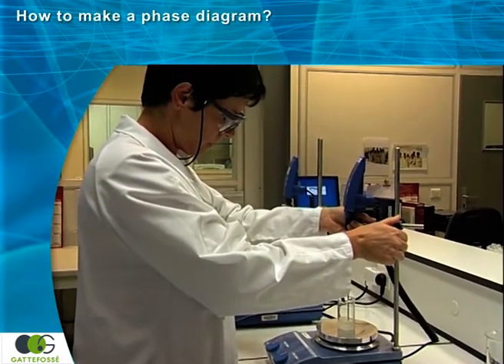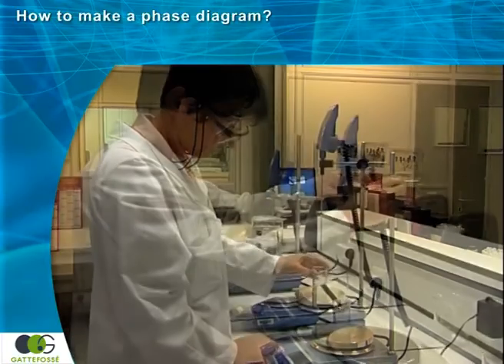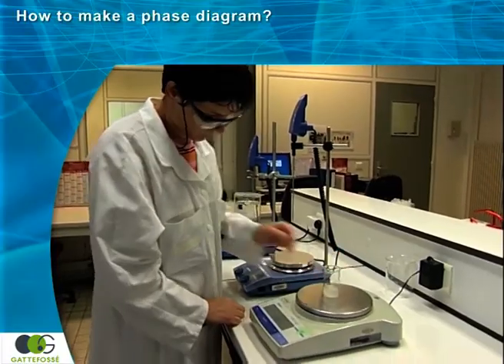The titration is stopped, and the formula is weighed in order to determine how much water has been added. The amount of water is recorded.